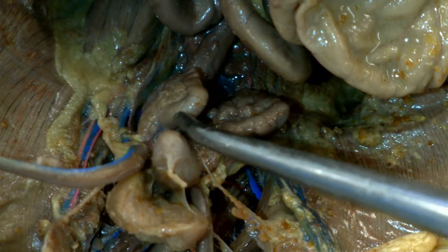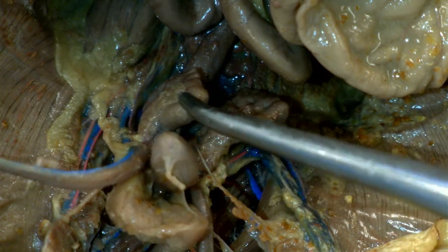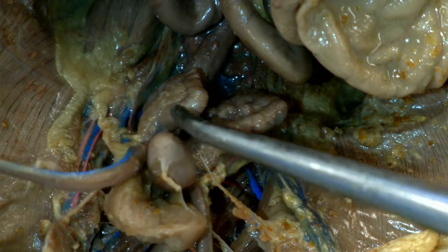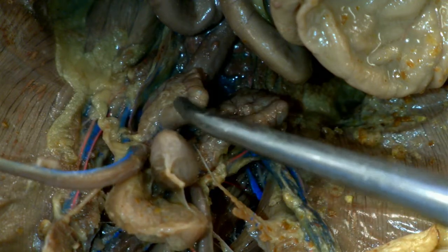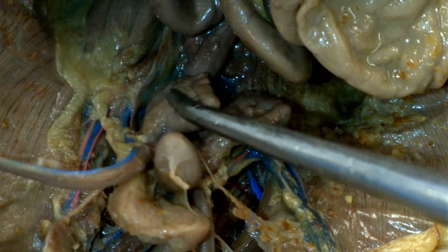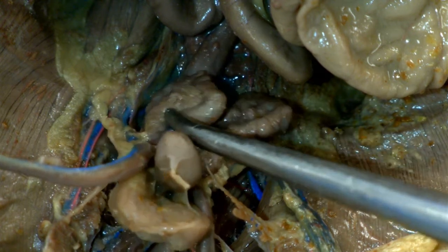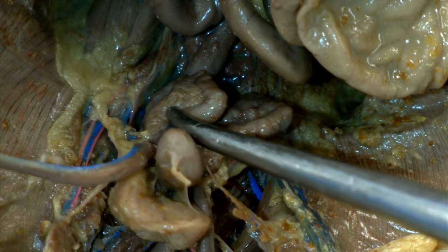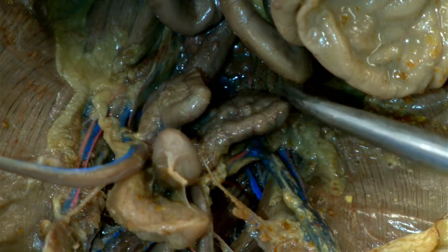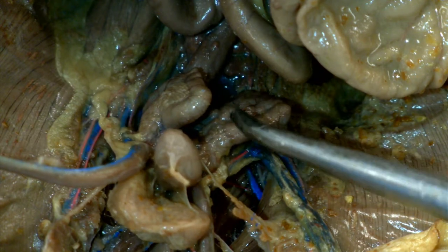You can see there's a distinction right there around the edge — the vesicular gland occupies the border of this structure, and deeper right here is an adjoining gland called the coagulating gland. So we have vesicular and vesicular, and then coagulating.